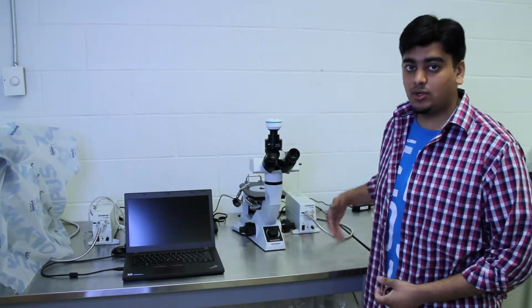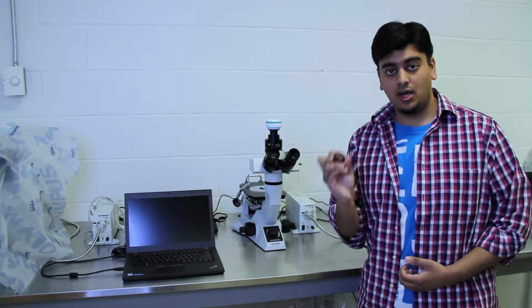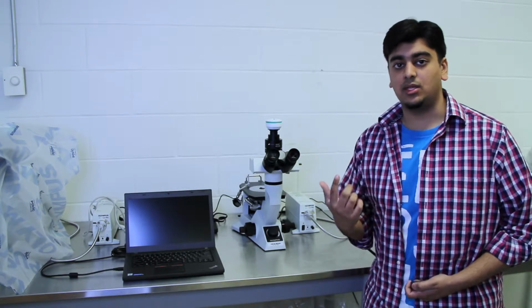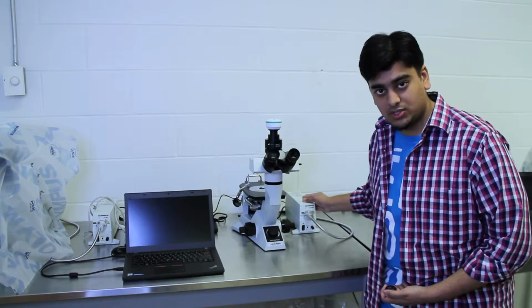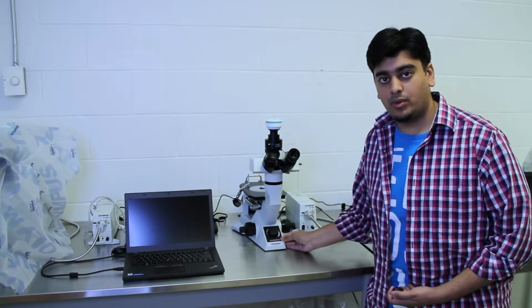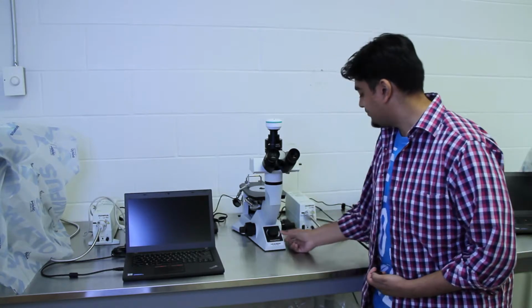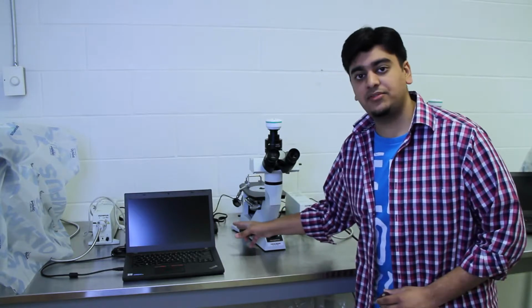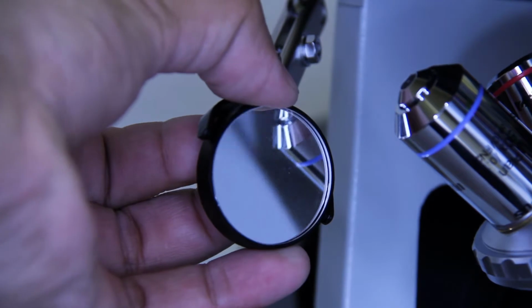So for the inverted microscope, we have the bed of the microscope at the back, and also when we're placing our sample, instead of placing it upright, we're placing it upside down because the light source comes from underneath. Also, the light source is external, so we have to turn the external light source on and the microscope on as well before we can actually place our sample. Now, when we're placing our sample, there's a little mirror on the left side that we can look at to line up our sample with the light source that's coming through.